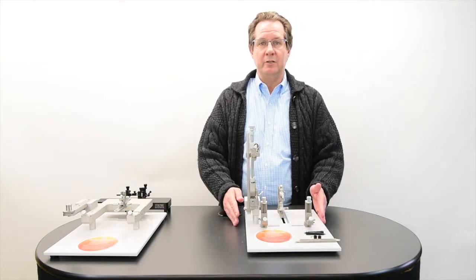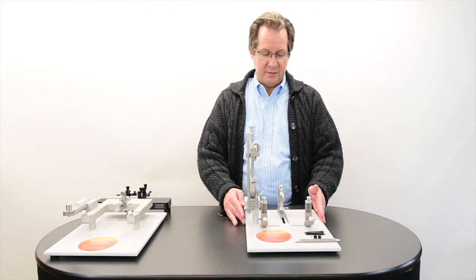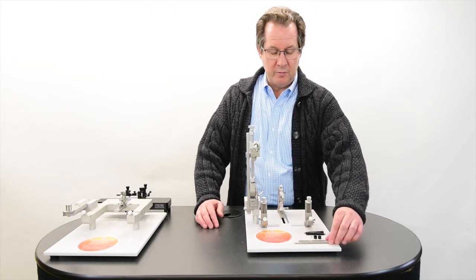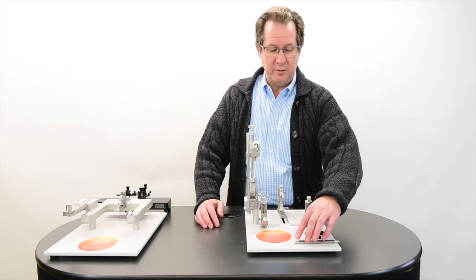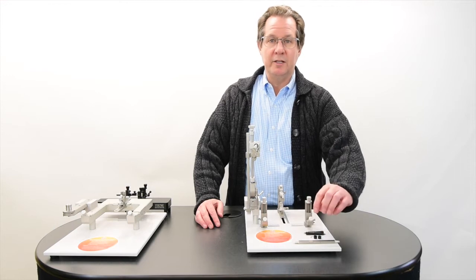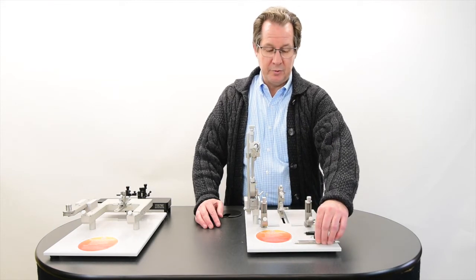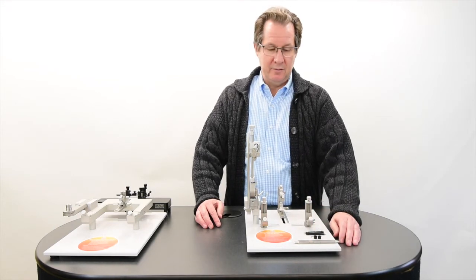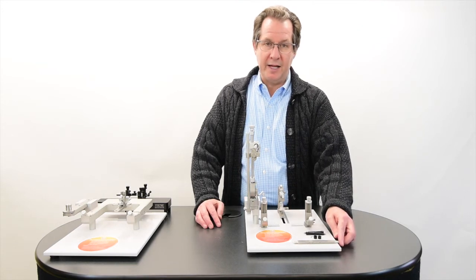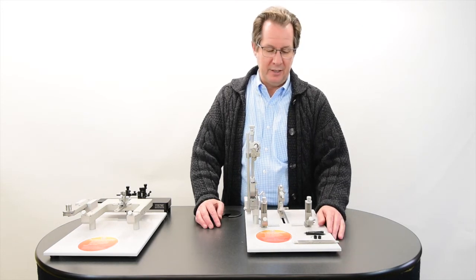You see here these are the ear bars for rats. These are the 45 degree tapered non-traumatic ear bar side, and then this is the more traumatic, more traditional 18 degree side.